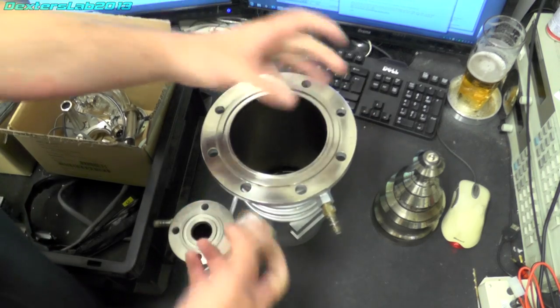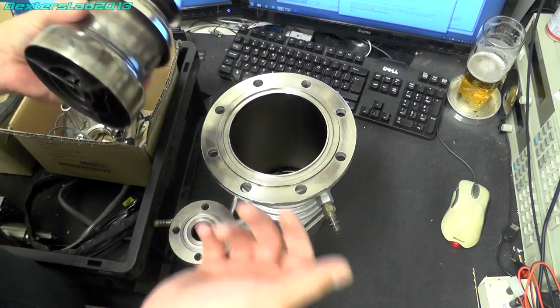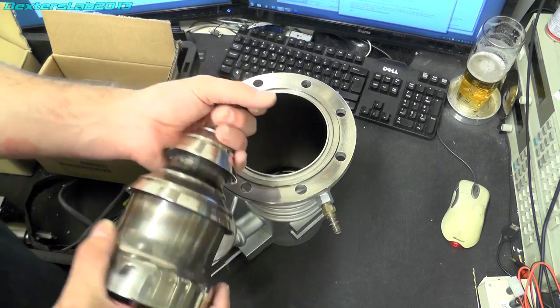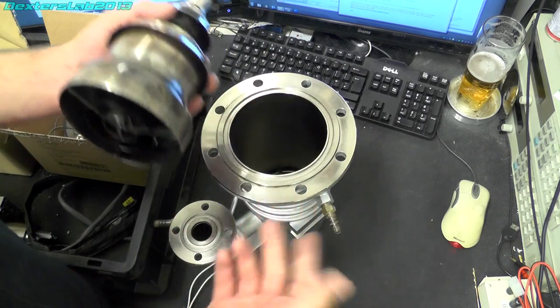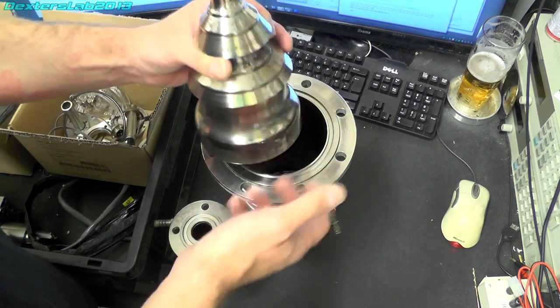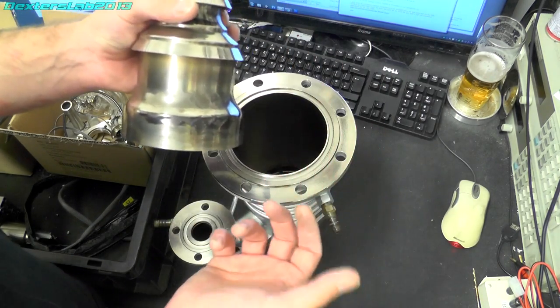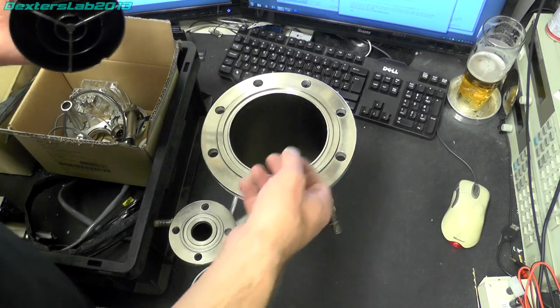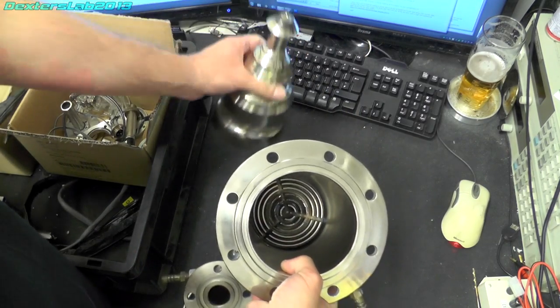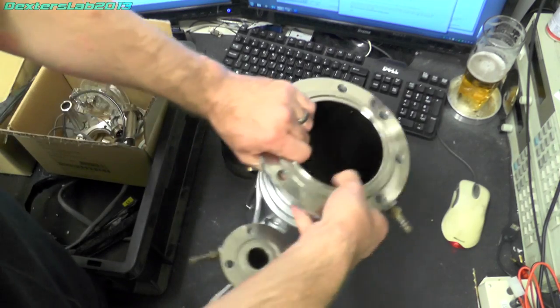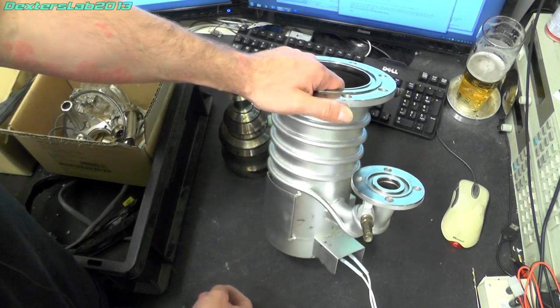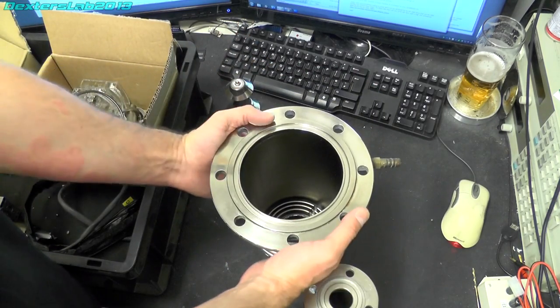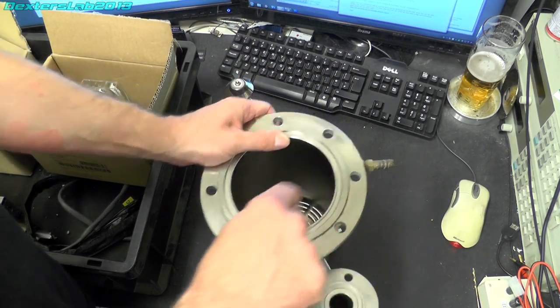So basically the oil and the remaining bits of gas that are in the system stick to the oil and they travel down and the whole lot gets blown down. Or the oil sticks to the particles and they then stick to the wall which is then chilled with water. That's what these pipes are here for.